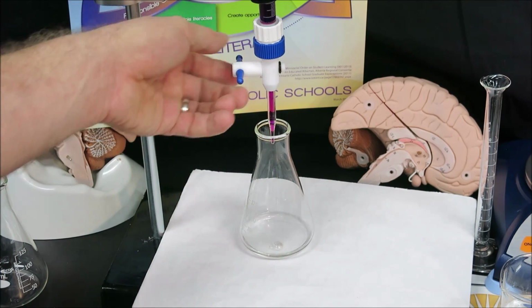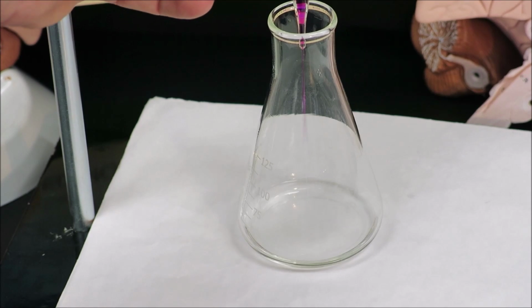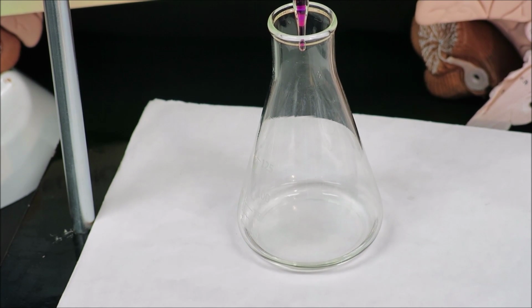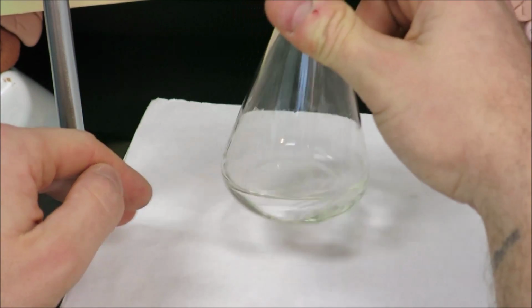What this shows is that we're nowhere near the equivalence point of the reaction. So again, we'll show that dripped in and how it fades. Now, it's really important not to just drip like this and then look and drip and look. We have to make sure that we're titrating properly, which includes holding the flask, and I raise mine slightly off of the surface, and I swirl.